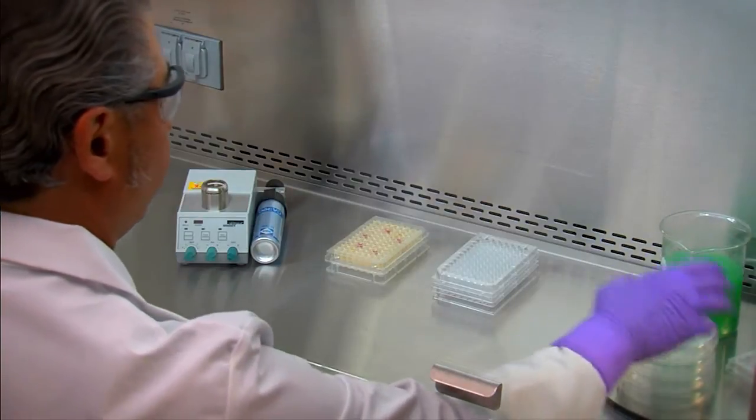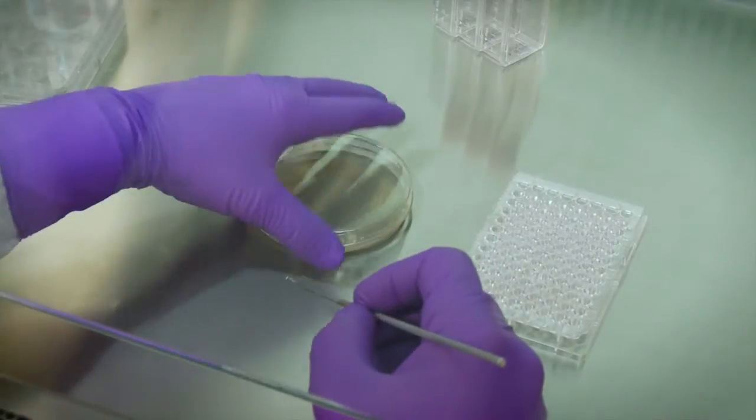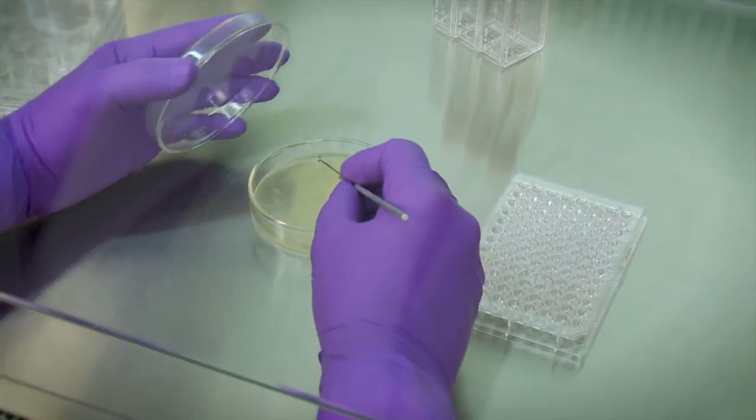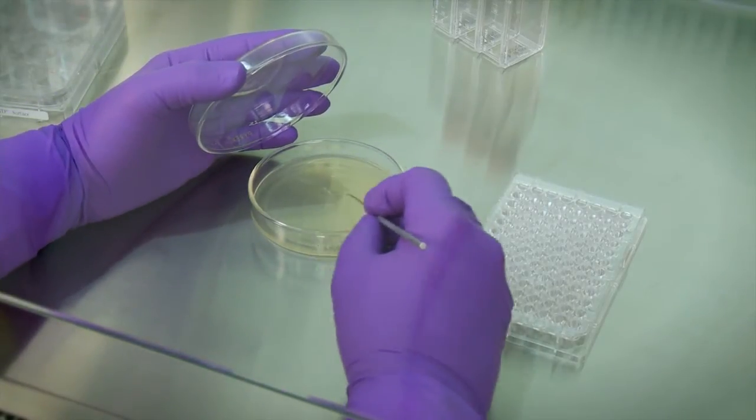Investigators working with petri dishes and tissue culture plates should hold the lid above the open, sterile surface to minimize direct impaction of downward air.